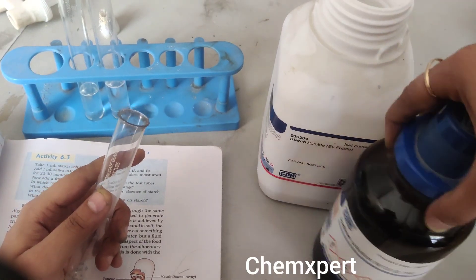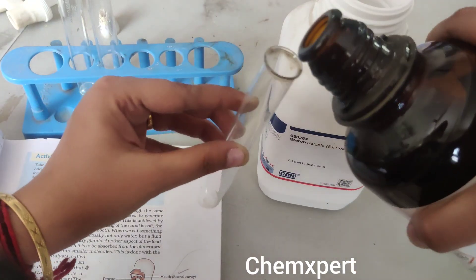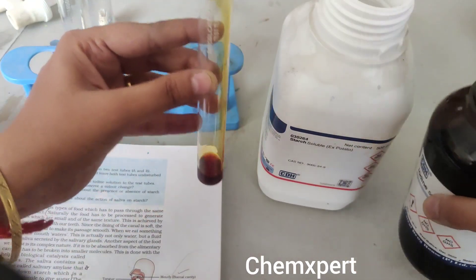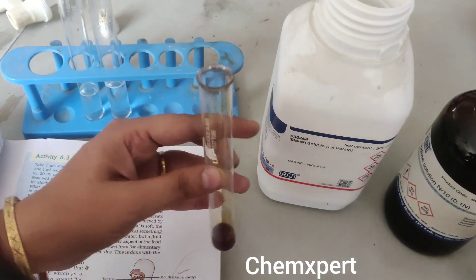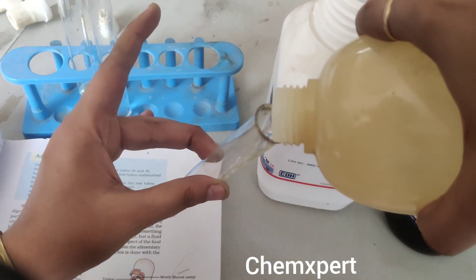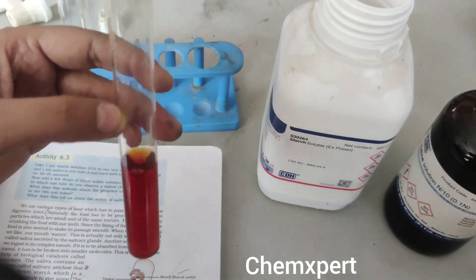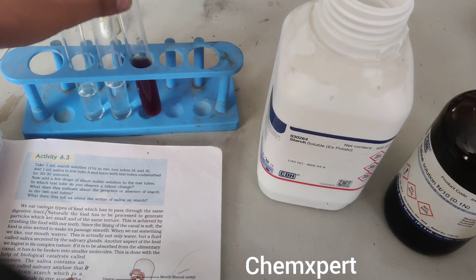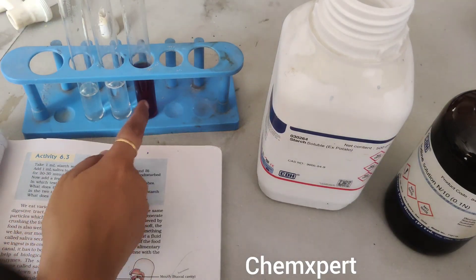After preparing the two starch solutions, the next step is to take the iodine solution in a test tube. We have to take a very dilute solution, so I will add a few drops of iodine and then add water into it. Now this is a very dilute solution of iodine.